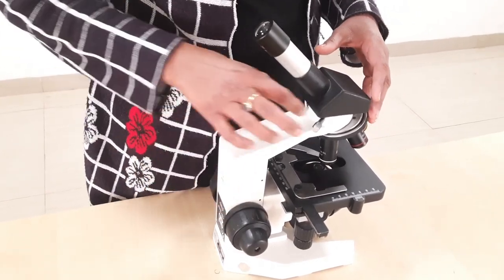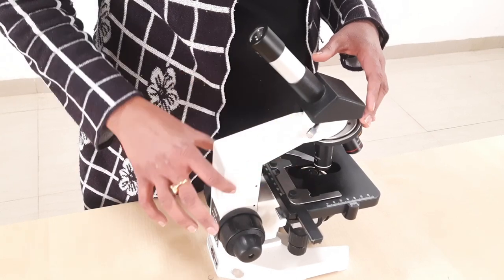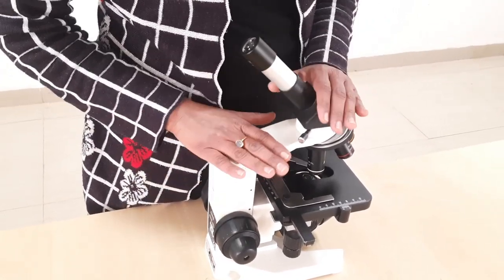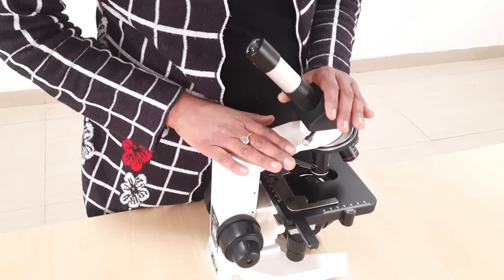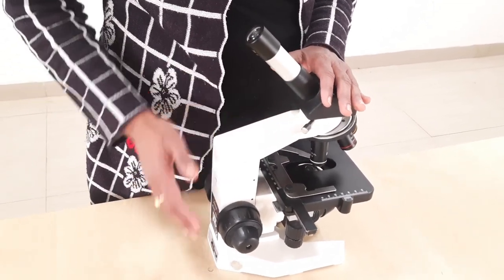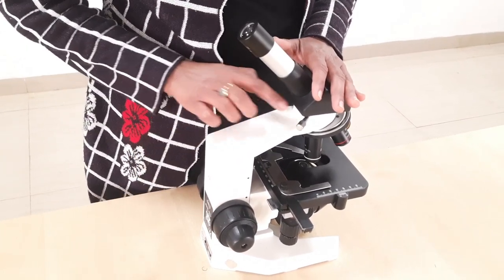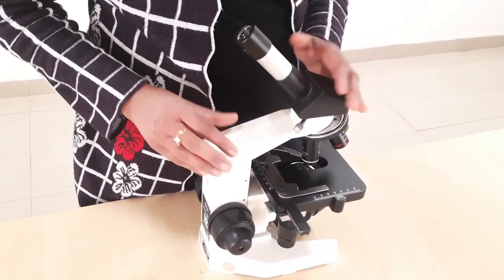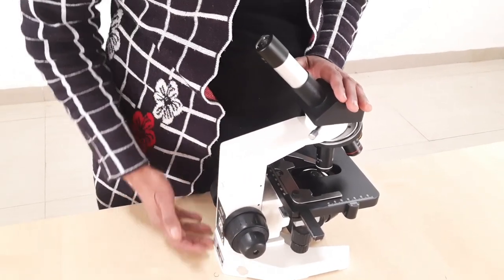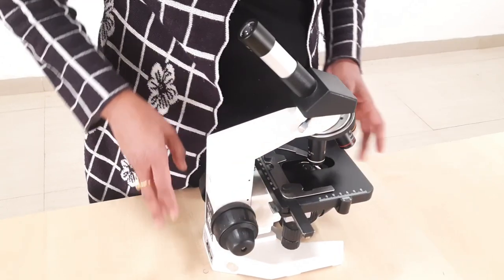In older microscopes the pillars were connected with a C-shaped handle by a hinge joint, but in this newer variety we have a single L-shaped handle made of heavy metal, which is attached perpendicularly over the base and supports many parts of the microscope.